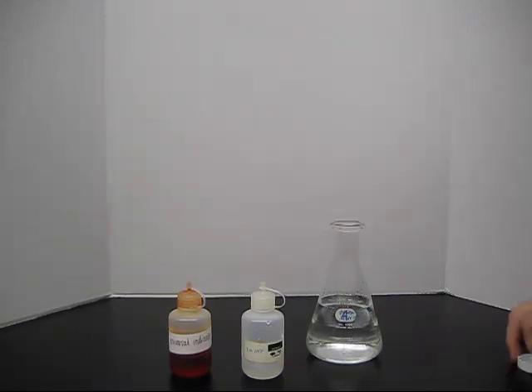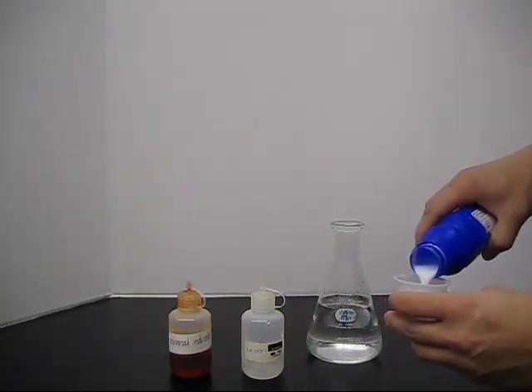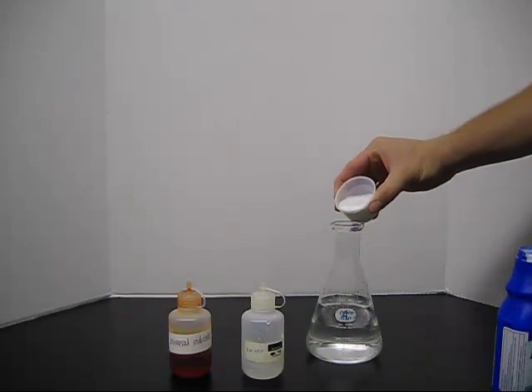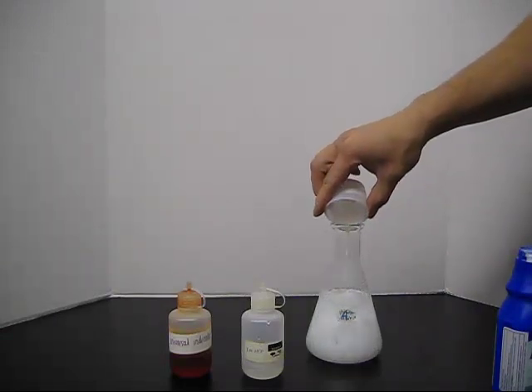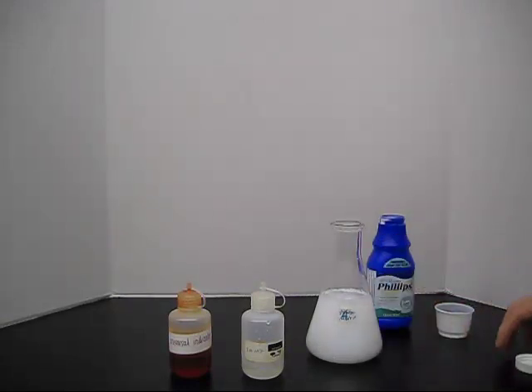And to that we are going to add one of these capfuls of milk of magnesia, and that is about 20 to 25 milliliters. And it will go into the solution somewhat, but it does have a limited solubility, so not all of it dissolves in right away.